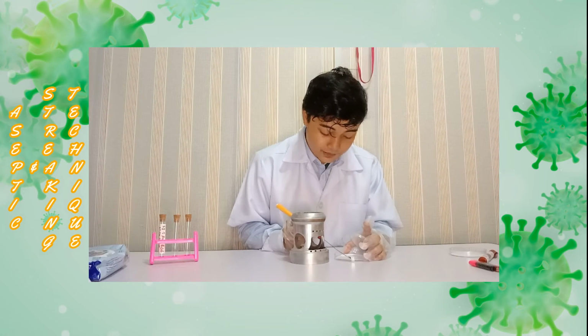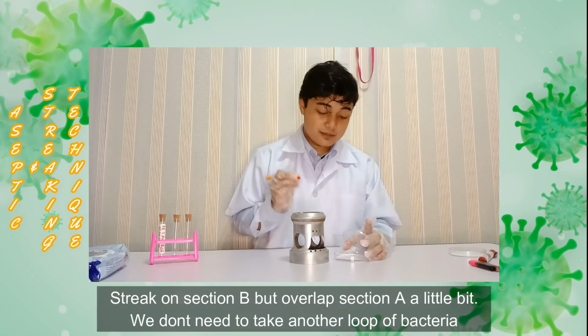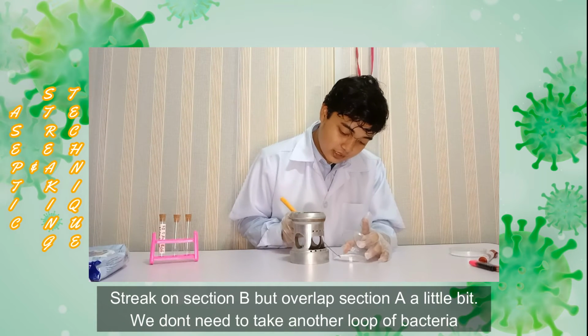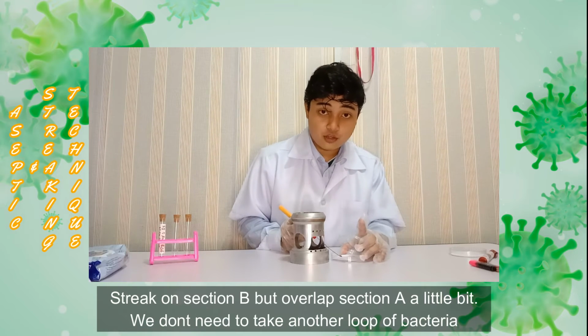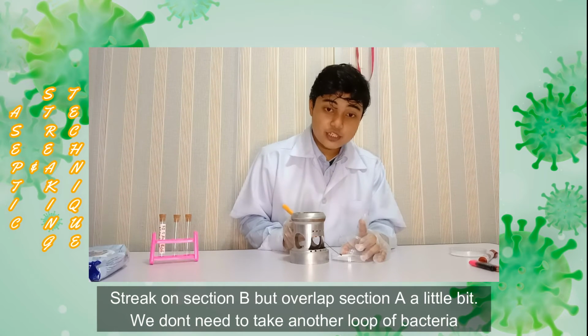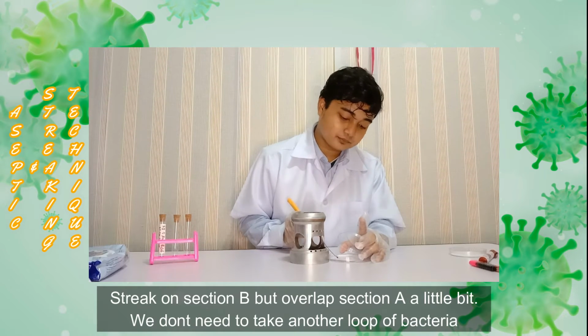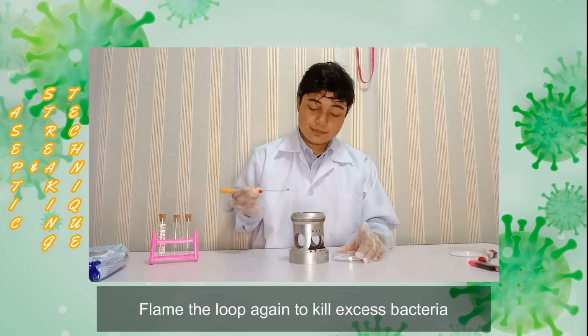If the agar plate does not melt, so it is ready, cool down. Okay, so this one is ready. We will streak again back and forth on section B. We don't need to take another loop full of microorganism, but we need to overlap section A a few times. Then we need to immediately close the plate again.